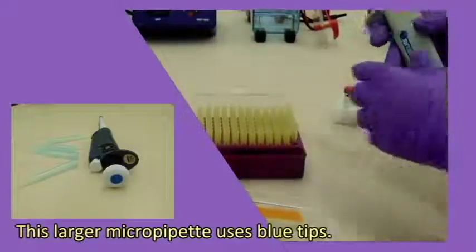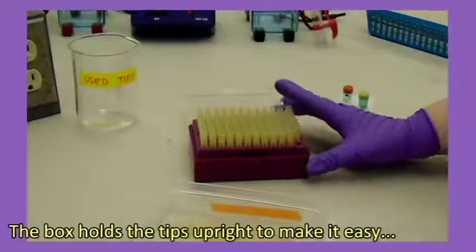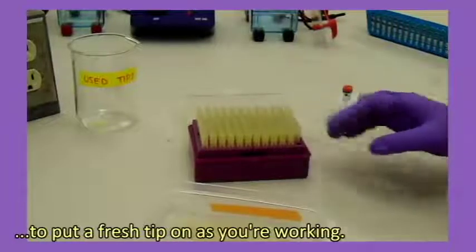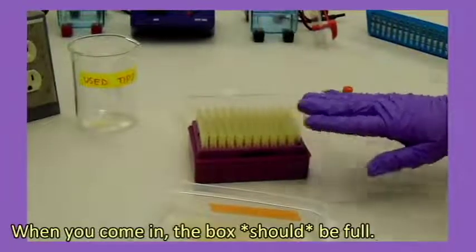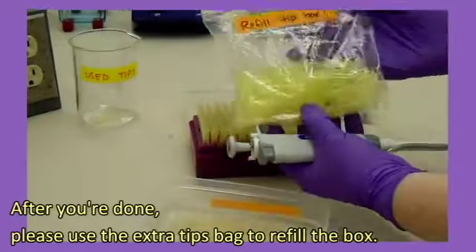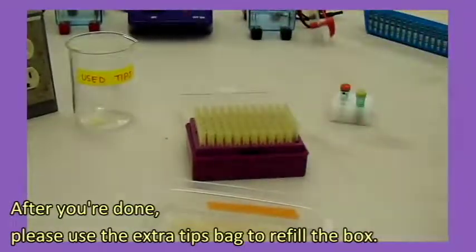This larger micropipette uses blue tips. The box holds the tips upright to make it easy to put a fresh tip on as you're working. When you come in, the box should be full. After you're done, please use the extra tips bag to refill the box.